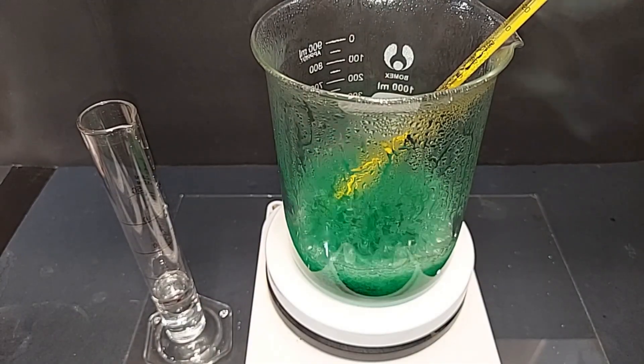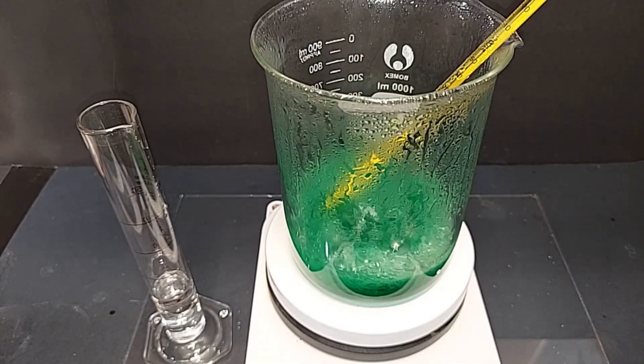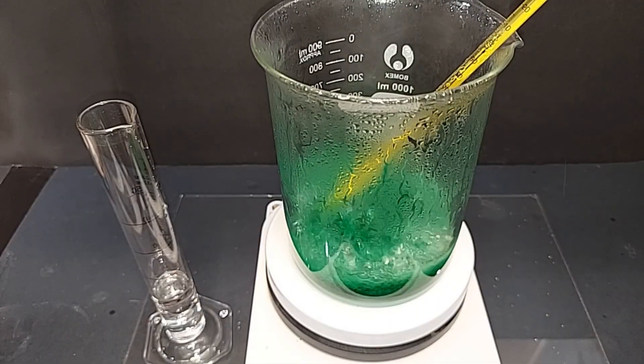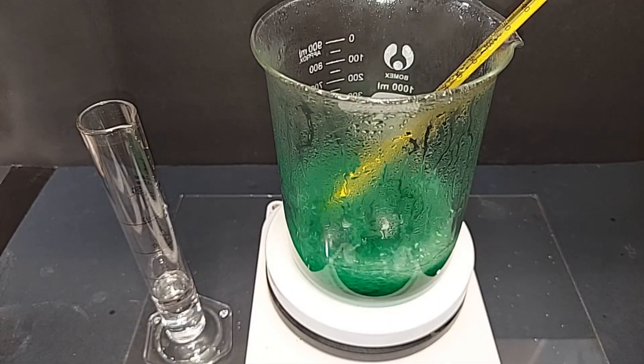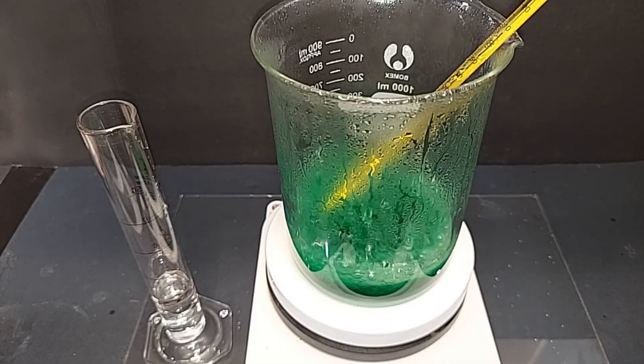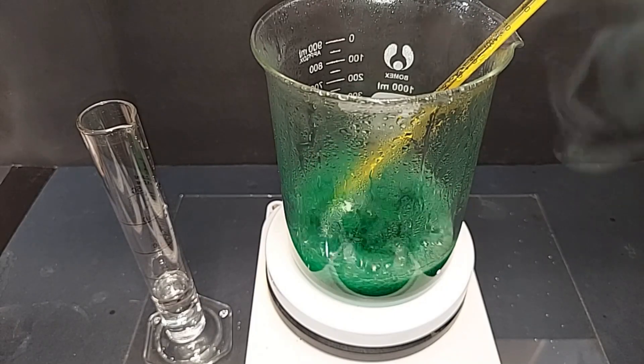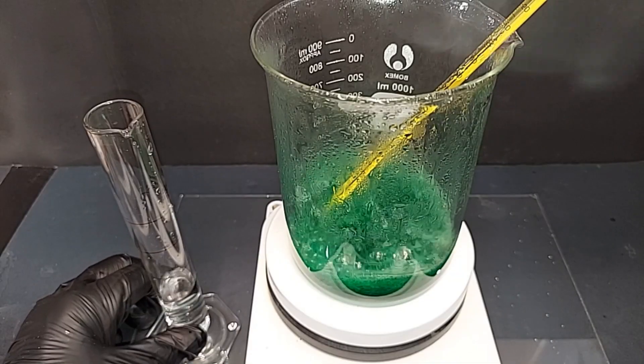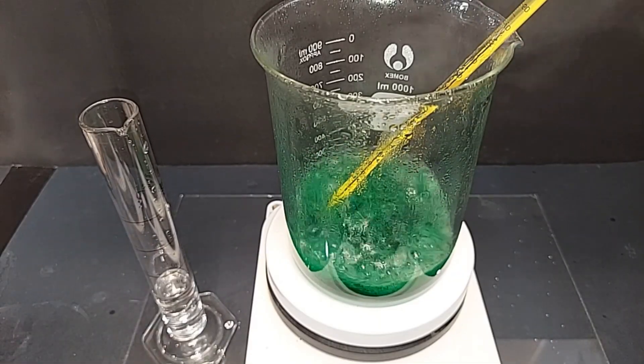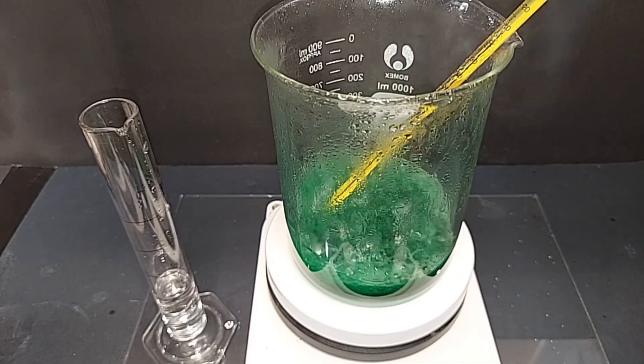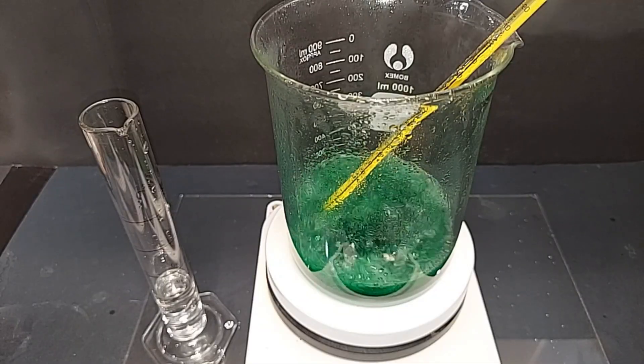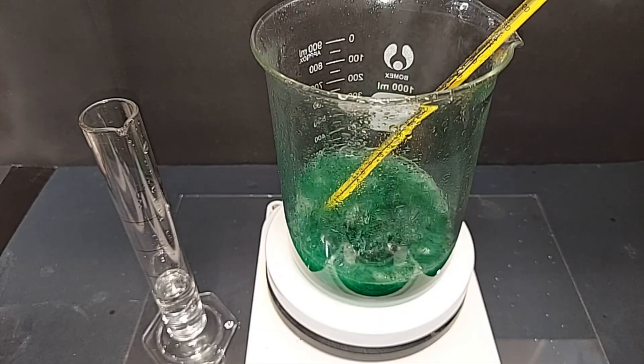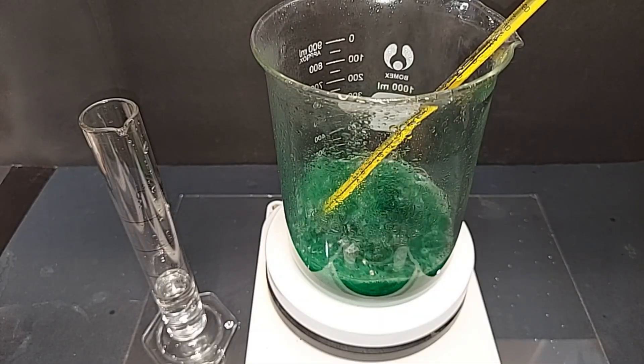I'm stopping the slow addition of the hydrogen peroxide to just show you what happened. It's up to about 105 degrees Celsius - you can't help that, it's just because this is exothermic. But you can see how aggressively the hydrogen peroxide worked. I added about 50, here we're down to 28, about 30 milliliters of the 30%, and let it sit, didn't want to add any more. Eventually this happened maybe 10 minutes later, so you got to be careful.